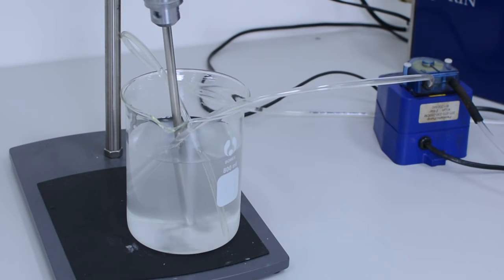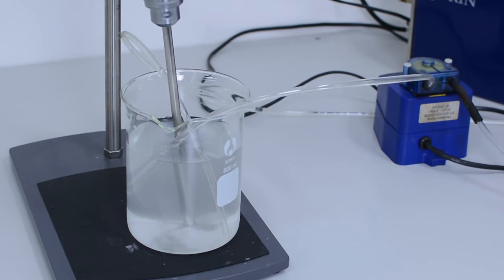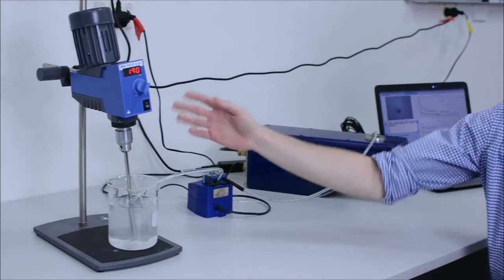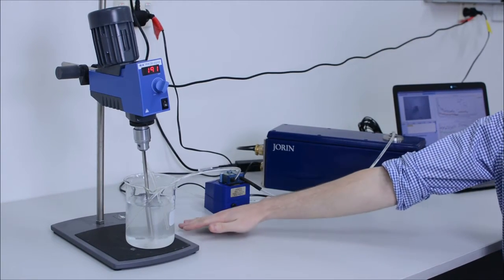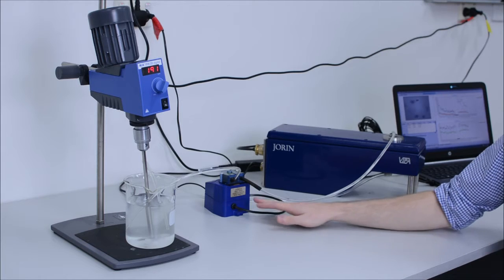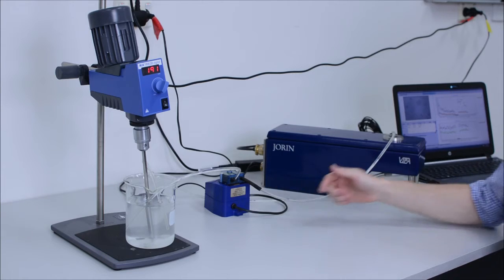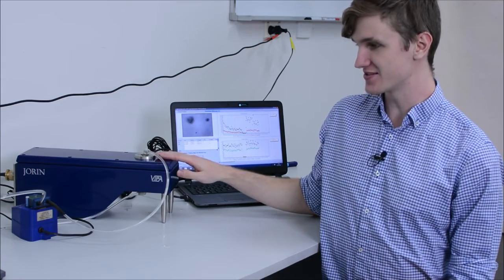So here we have our sample. At the moment we have ceramic beads which are simulating oily water. We have the sample being continuously mixed so that the beads don't settle on the bottom. We have a pump here which is pumping through, and then the flow goes into the particle sizer.